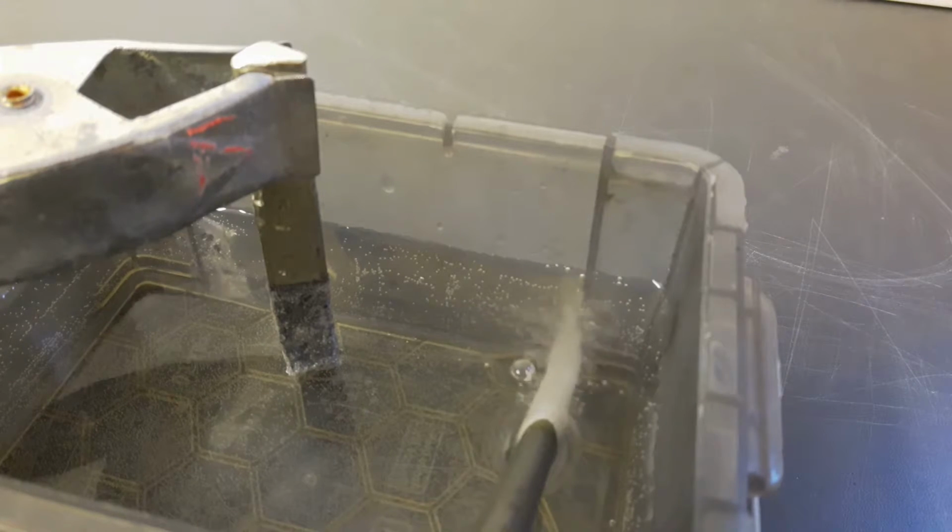So the only thing that will happen in this reaction is that I will separate the tin from the copper in this alloy. So we will get rid of all the copper and then we will be left with whatever 99% tin. I think that's a good deal.